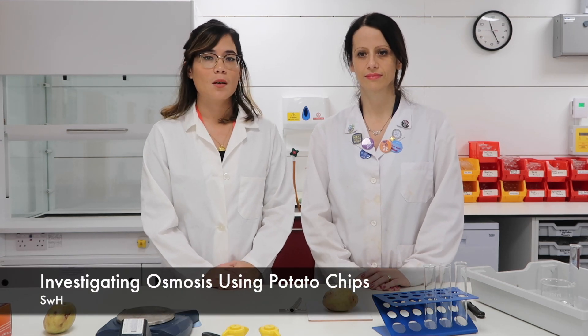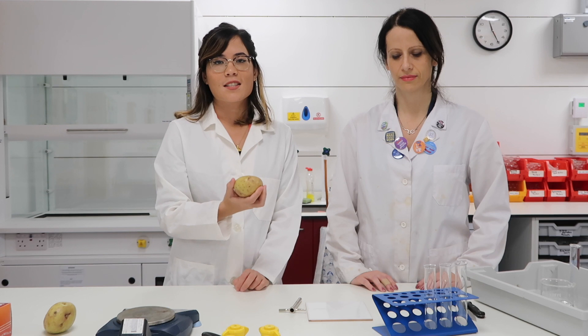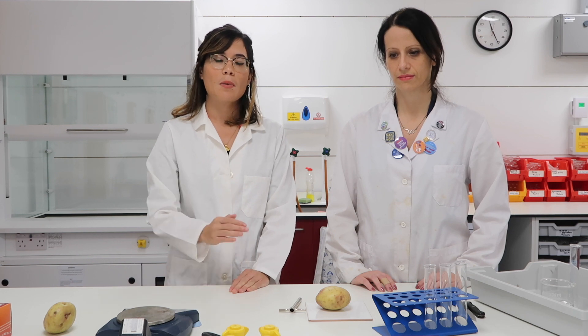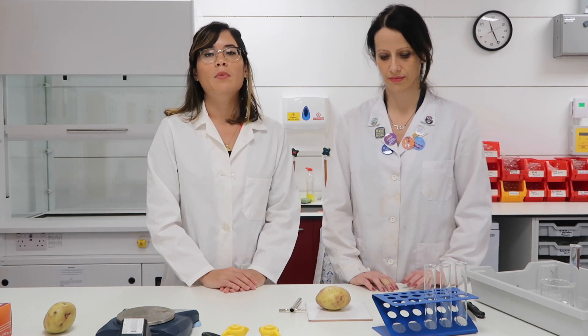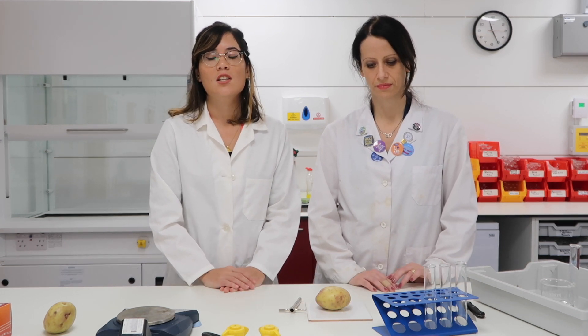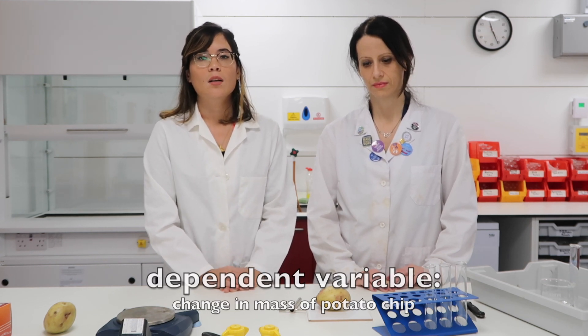In today's video Emilia and I are going to show you how to do the key osmosis experiment, which involves looking at the change in mass of a potato placed in different salt solutions. The crucial thing is that you understand your variables. The independent variable in this particular experiment will be the concentration of salt solution — we're going to be changing the solution that the potato is bathed in. Our dependent variable, what we're measuring, will be the change in mass of the potato, and then we'll have several control variables which we'll discuss throughout the practical.